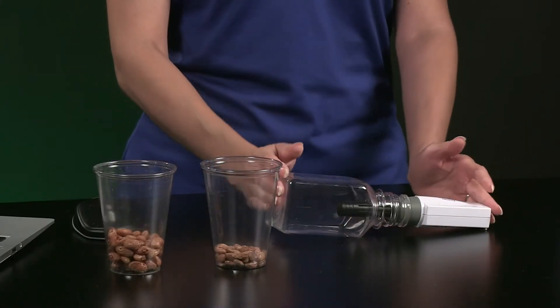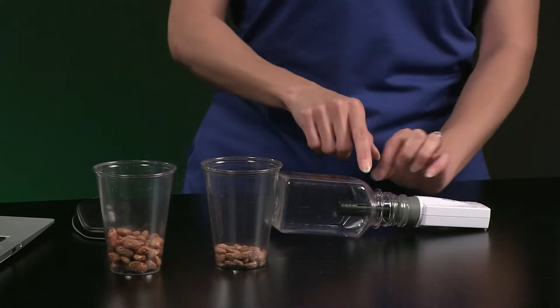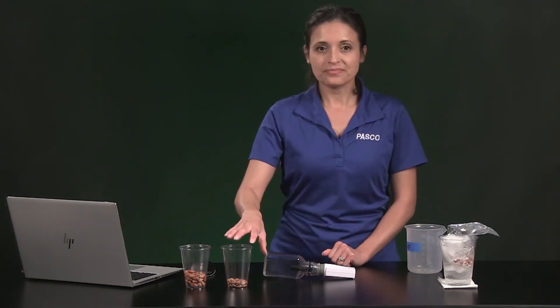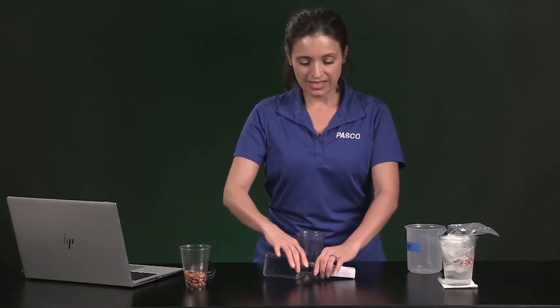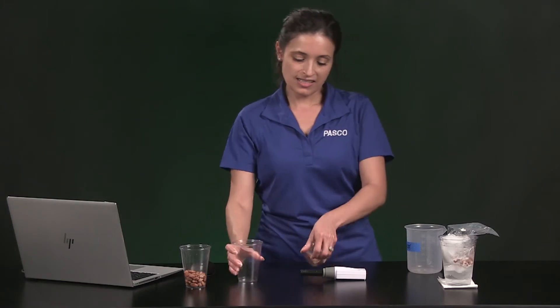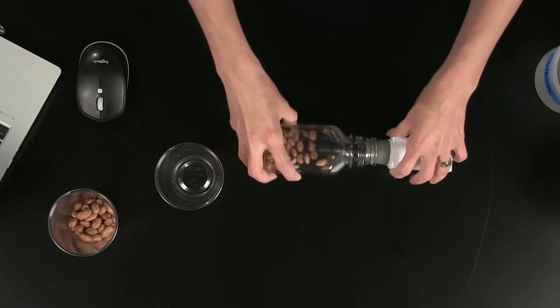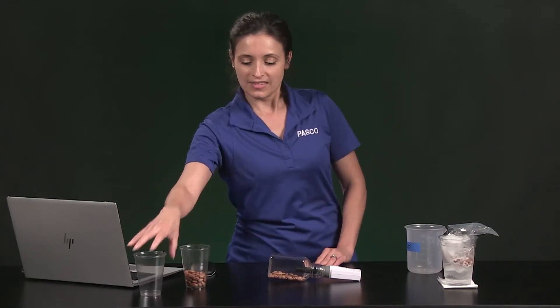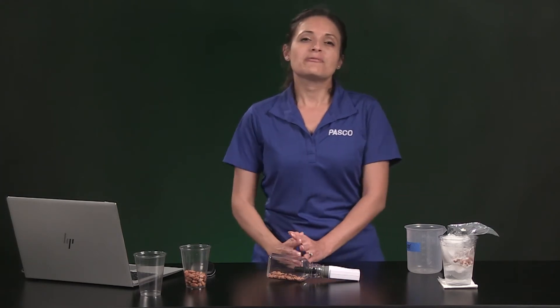When you put the sample in the container, make sure that nothing is touching the probe, and when we get to the wet samples, that there's no water touching the sensor. I'm going to place the dry seeds into the container and run the experiment sideways, because carbon dioxide is heavier than air and this way we get the maximum measurement of CO2. Before data collection begins, take a minute to think and predict how dormant seeds will affect the amount of carbon dioxide in the bottle compared to an empty bottle. Pause the video here and resume playback when you're done making your prediction.